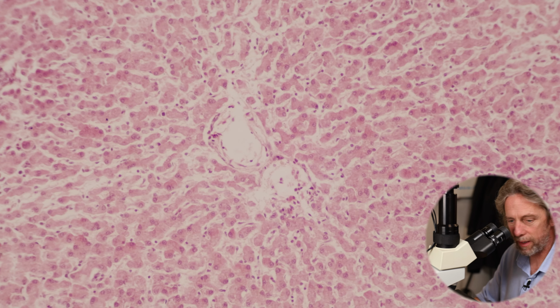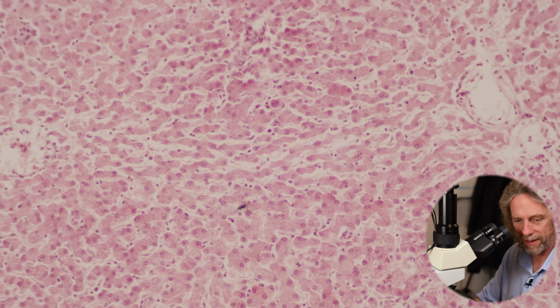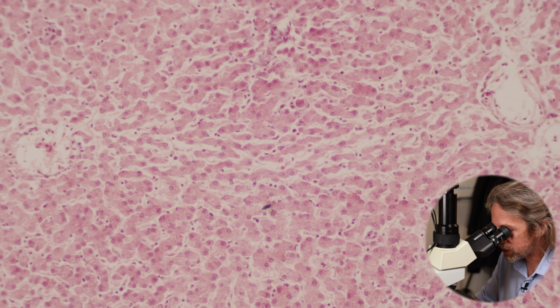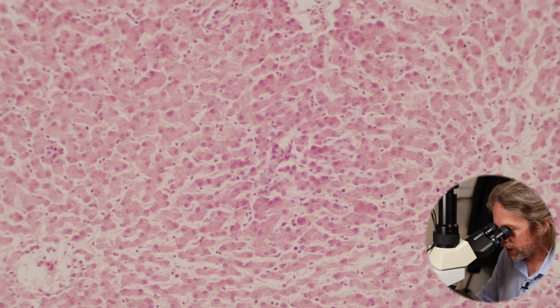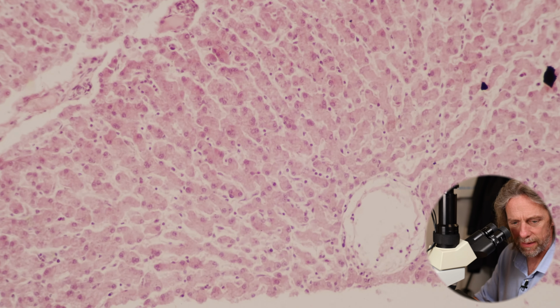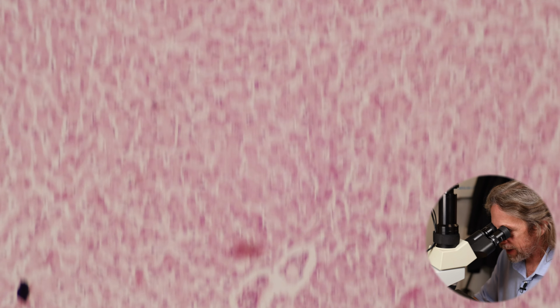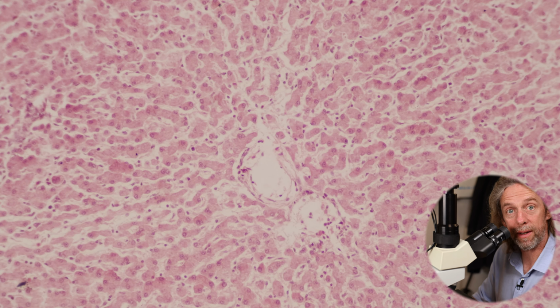If I go down to that central vein and then slide out that way, we can see, can you see? There's one central vein. There's the next central vein. Can you see how the pattern of sinusoids changes there? It links and overlaps, and there's kind of a wall of the hexagon there between that portal triad and the portal triad that there's a bit of there, and there's another central vein down there, and there's another portal triad over there, and there's another. Anyway, biology. Sorry, this is real life.